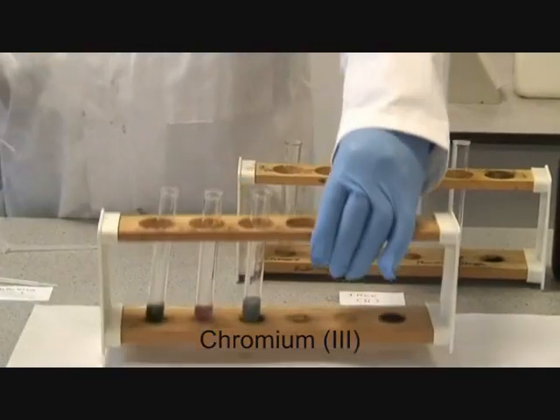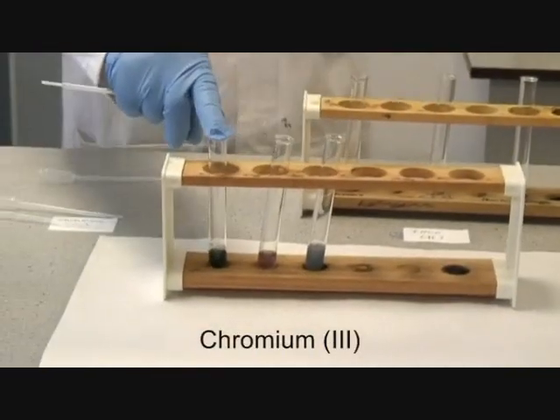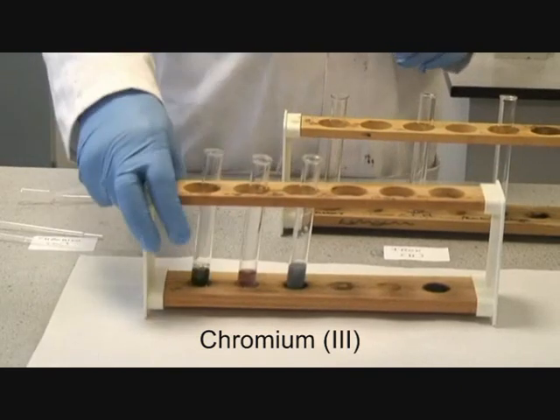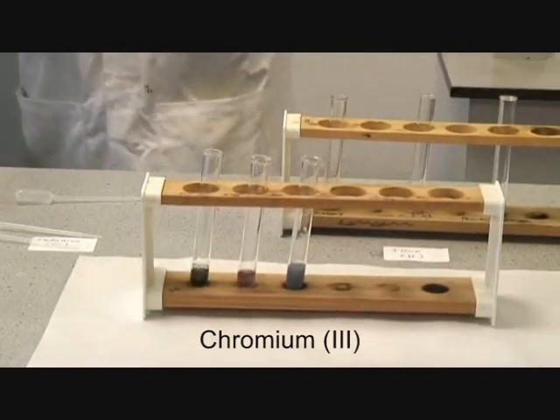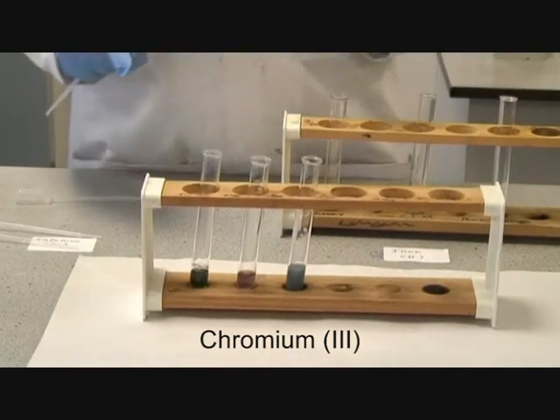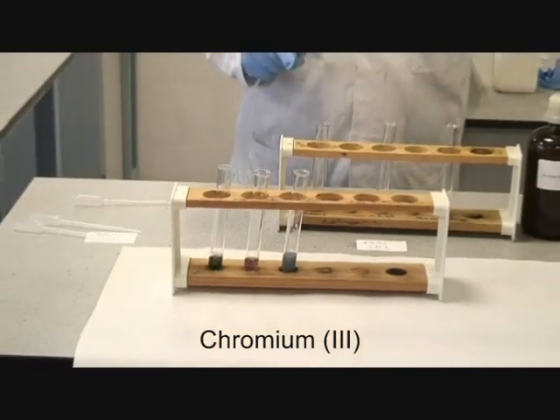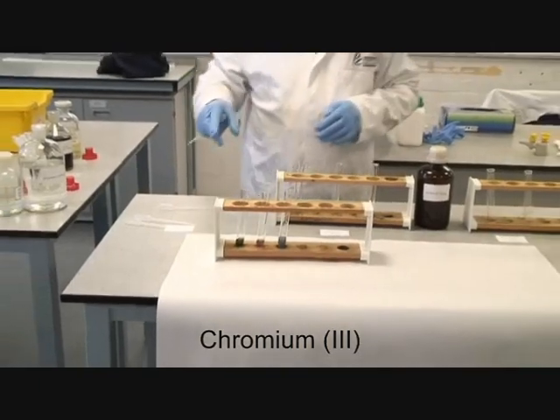So there are the results of the three reactions — we have just done the hydroxide, the ammonia, and the carbonate — and that's chromium 3. This procedure is now going to be repeated for five other metals: iron 2, iron 3, cobalt 2, copper 2, and aluminium 3. So as we go along, just note the effects of these.